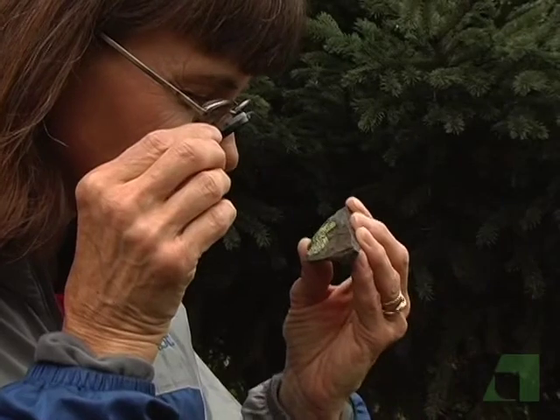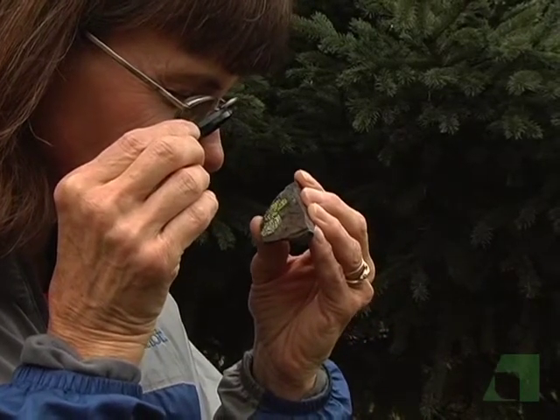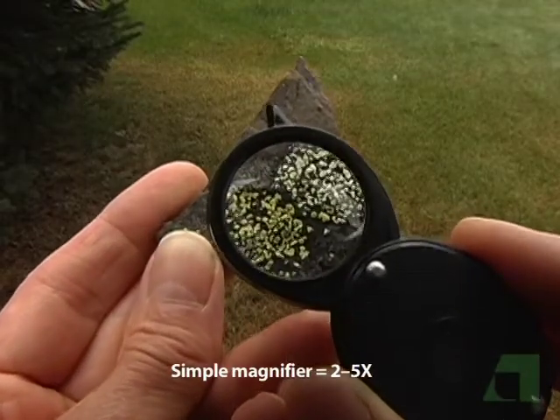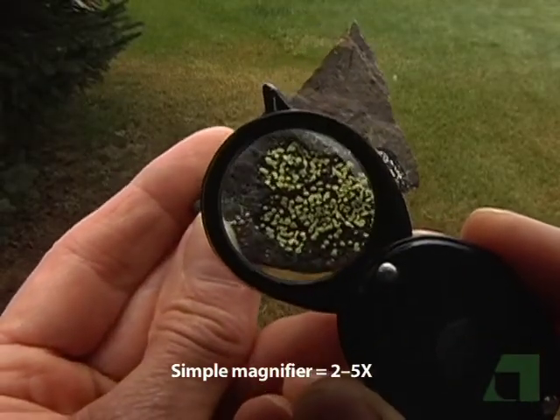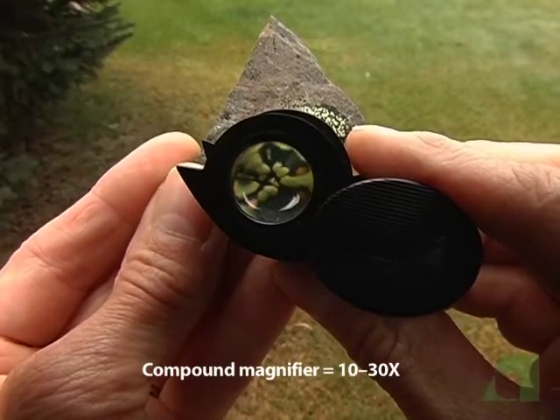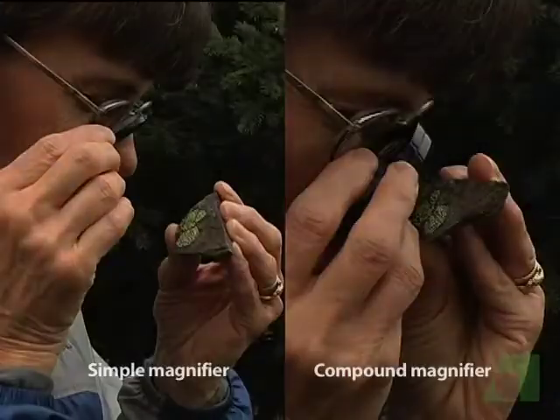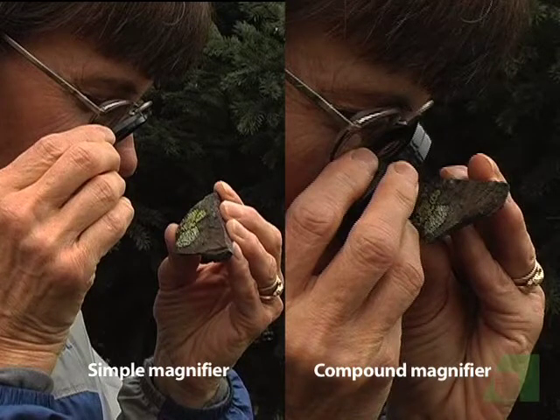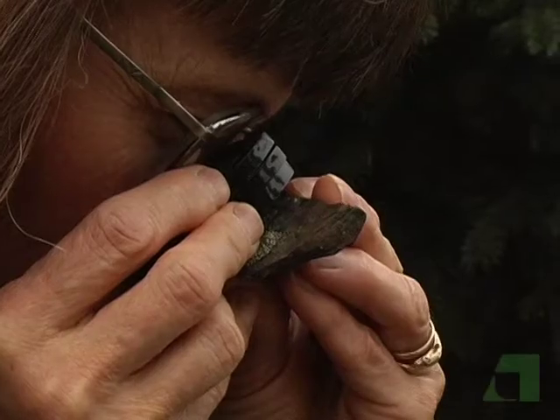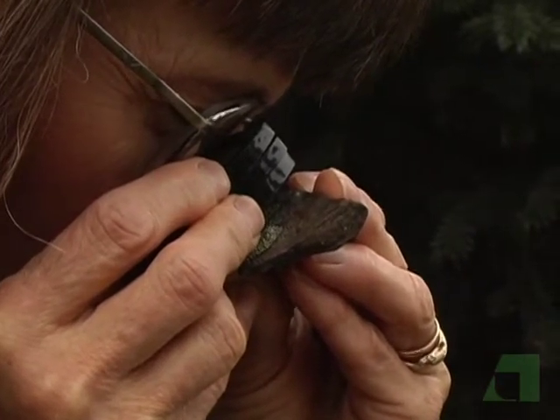The simplest way of making an enlarged image of an object is to use a magnifying glass or lens. A single magnifying lens produces an upright or erect image that is enlarged 2 to 5 times. With 2 or 3 lenses together, a compound magnifying lens can produce a magnification of up to 30 times. However, as magnifications increase, lighting becomes problematic because the lenses become smaller in diameter and must be held closer to the object and the eye. Also, at higher magnifications, humans become too unsteady for clear observations.